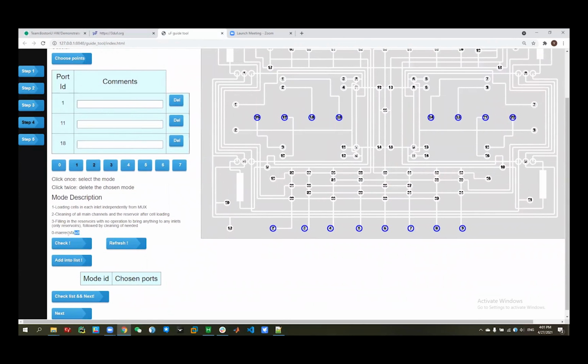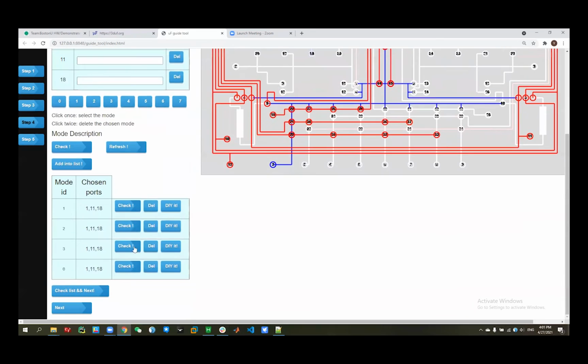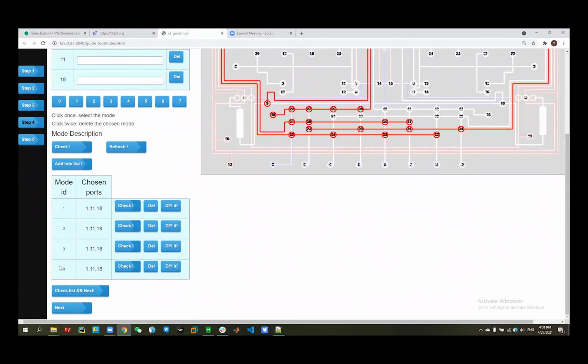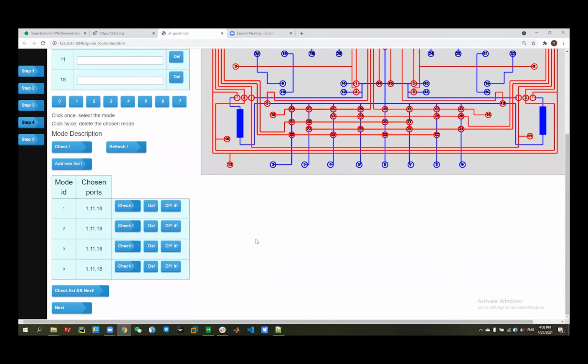So yeah, you can see the mode 0 has been changed. So we add all of them into it, and we can check it, and that is what we want. And all of them are the simulation pathway, just to show you how to control and what it looks like. And in the stage 0, the mode 0, it is like a new function for you, because if you think we cannot provide you a very satisfactory pathway, you can DIY it. You can change all of them.